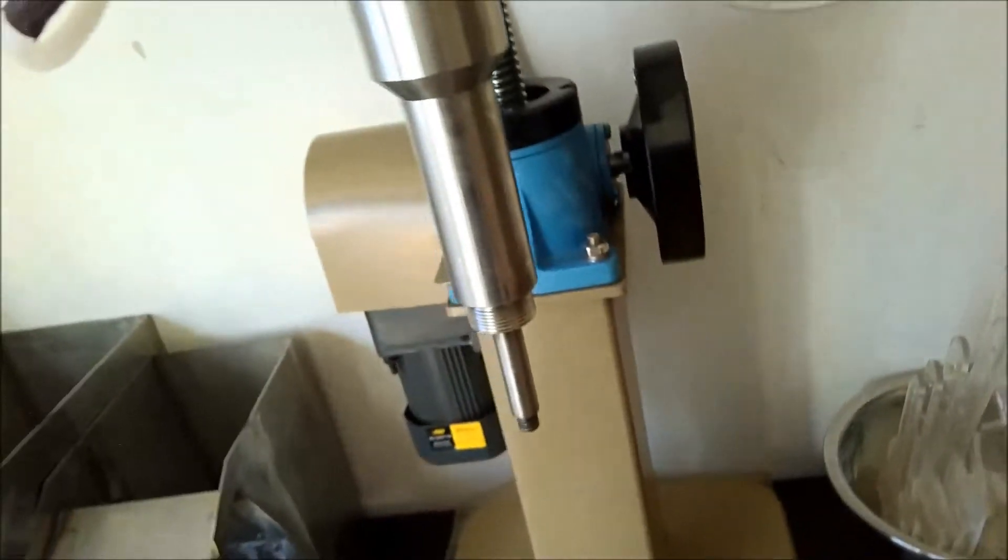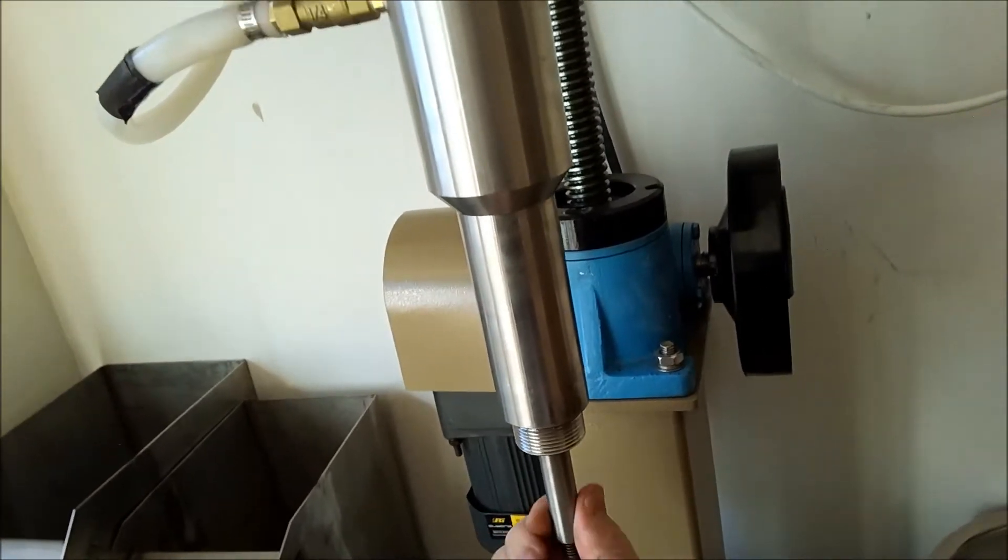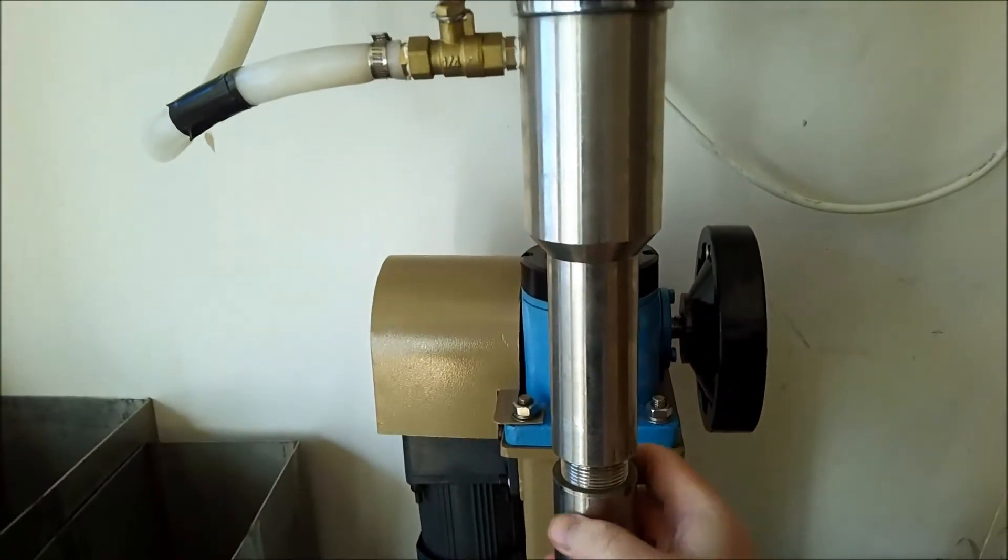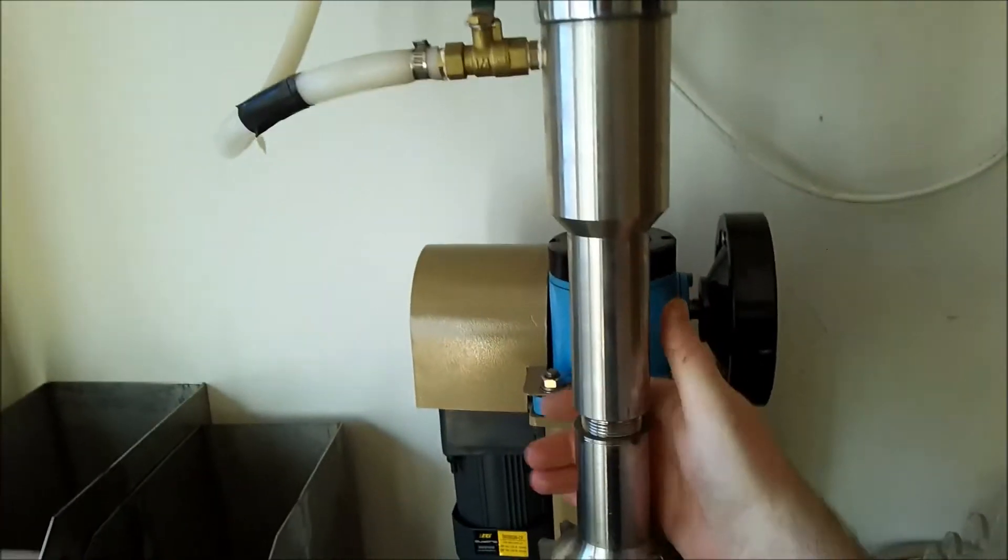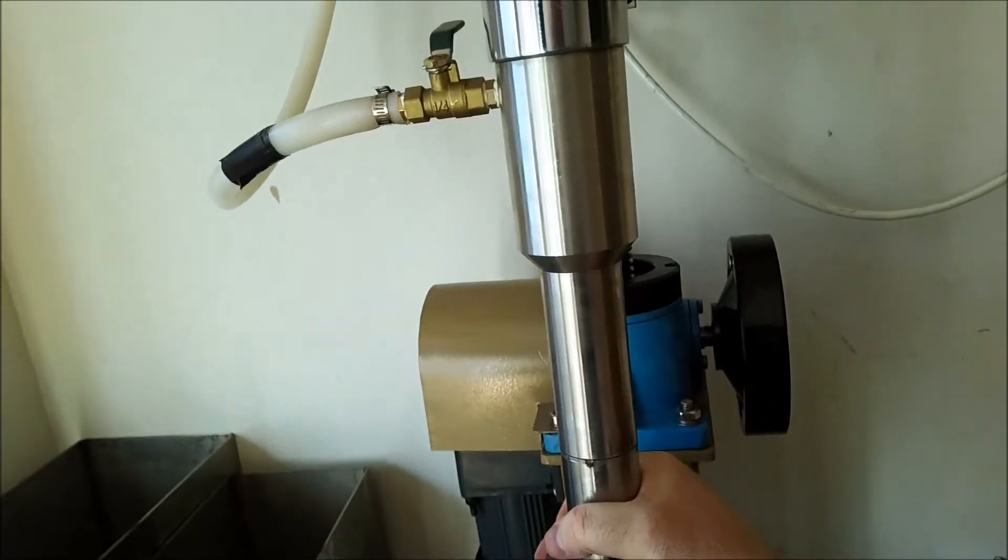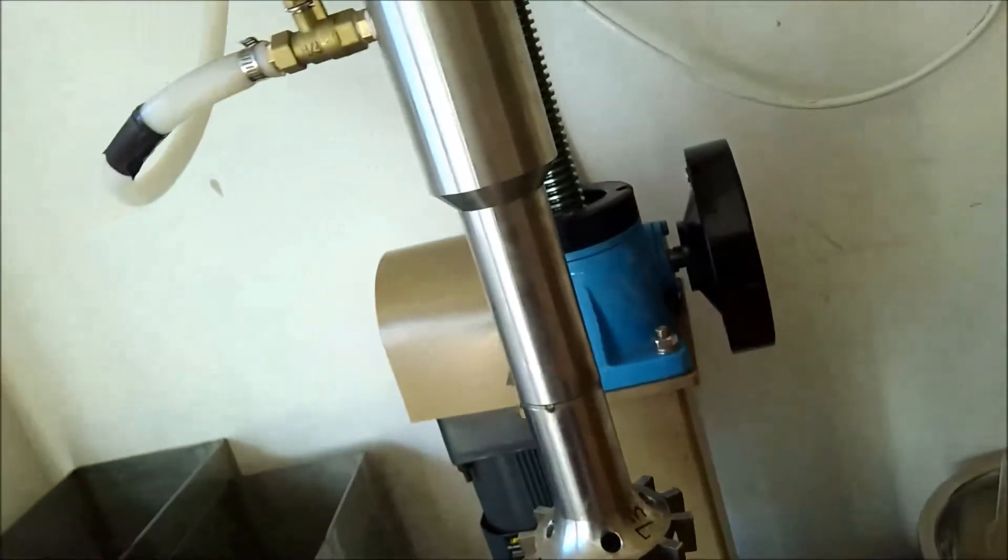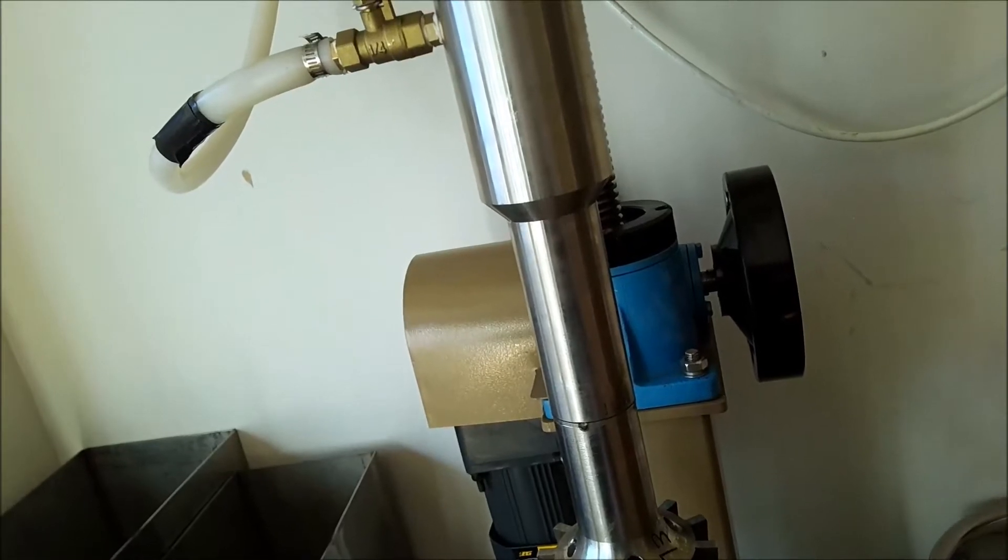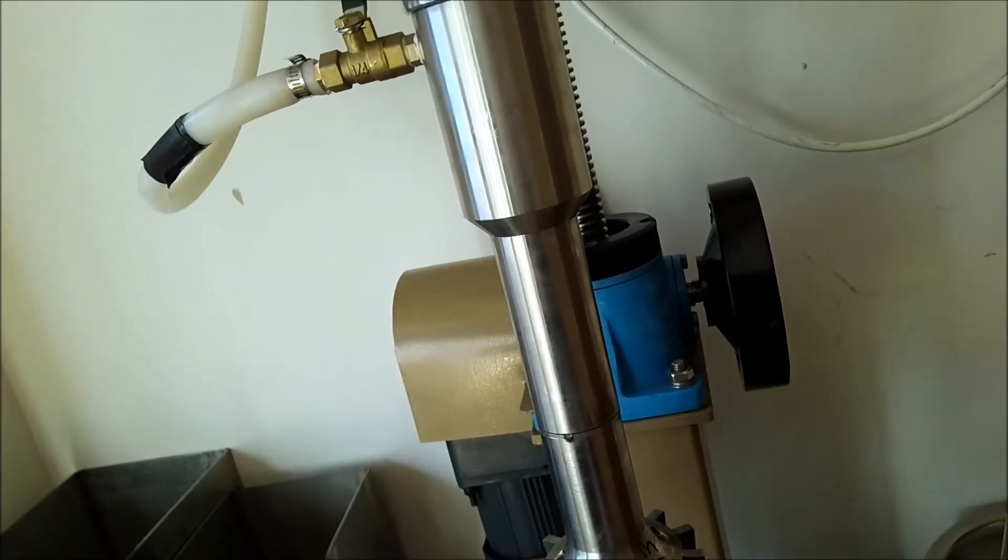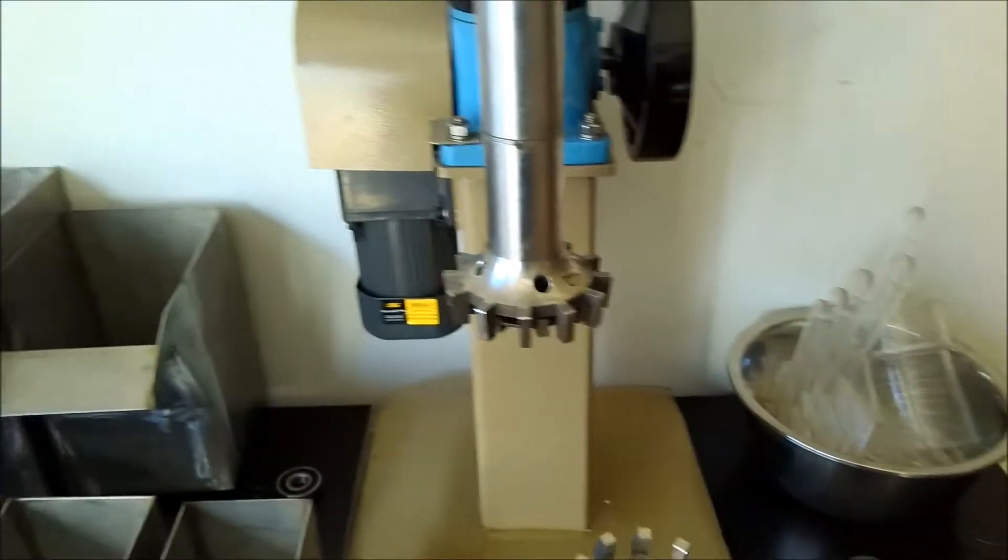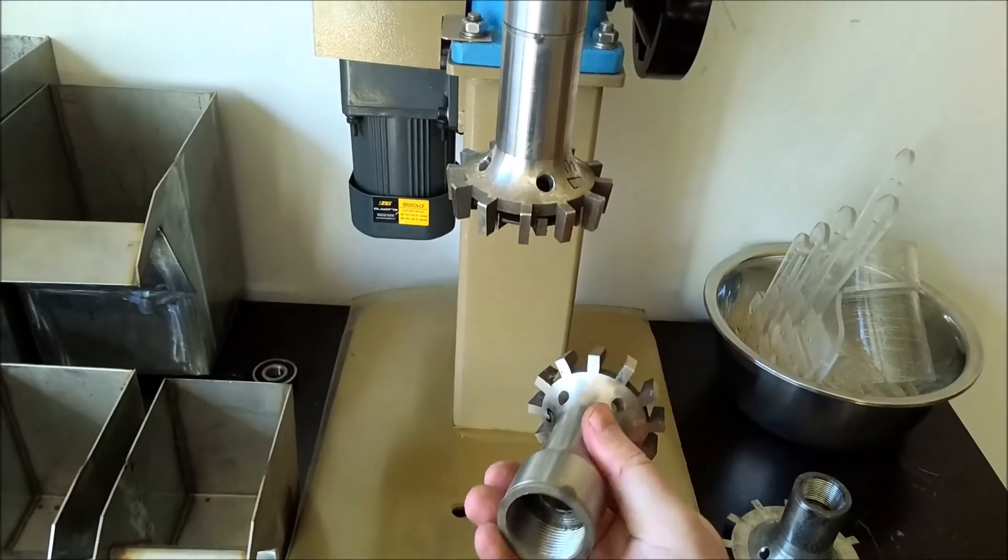Alright. So before we do this, see here, it turns freely. Alright. So the bearing is in great shape. These things thread on backwards, but the machining is incredible. It's very, very well done. Stainless steel.